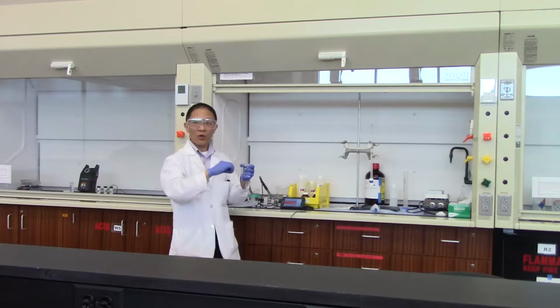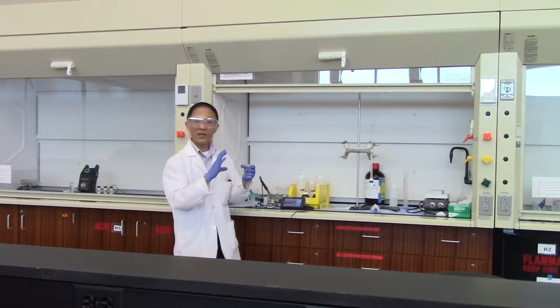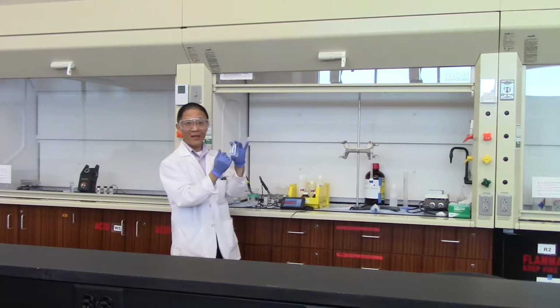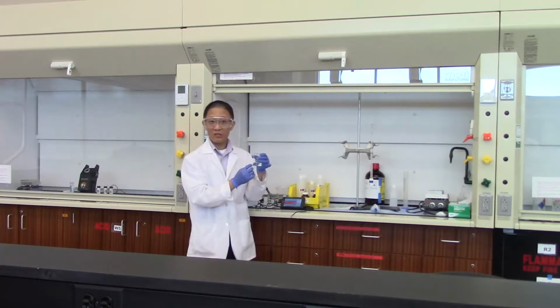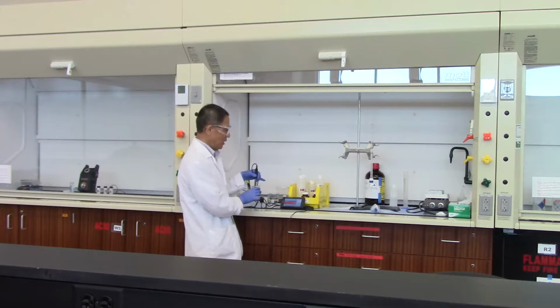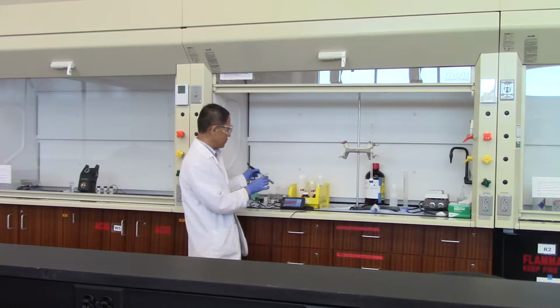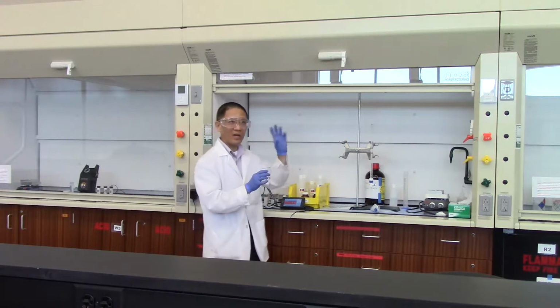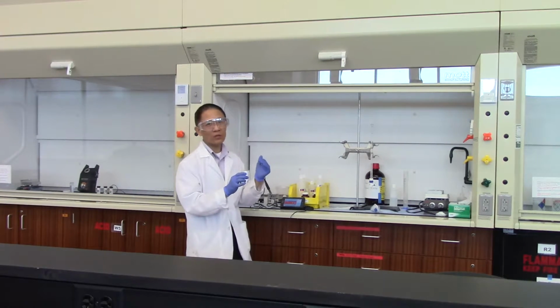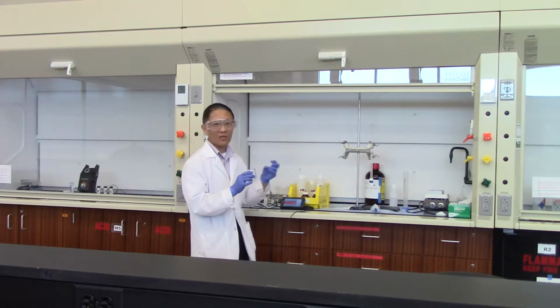Okay? So if you add water, if you dilute the solution, both concentrations get diluted, and therefore it doesn't change the pH. And so in this particular solution, we put 10 milliliters of the buffer A in here. We added 15 milliliters of water to it. And if you test the pH of this solution, you can see the pH is still somewhere around 4.05. Okay, so the pH of the buffer solution does not change when you dilute, add more water to it, or when you remove the water from it. Because when you change the quantity of water, you're changing the concentration for both the weak acid and the conjugate base, and the pH remains the same.